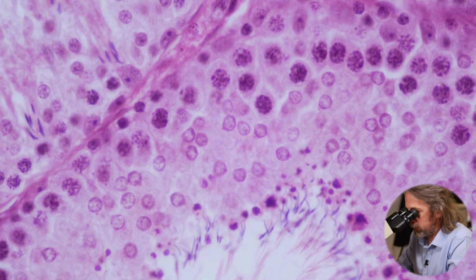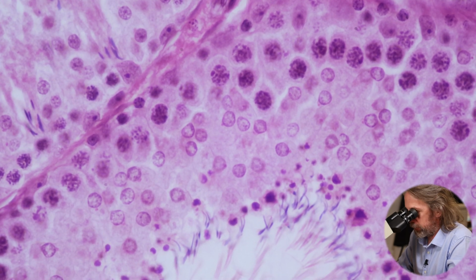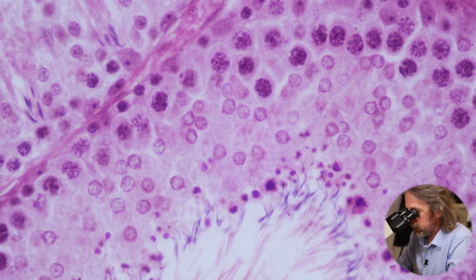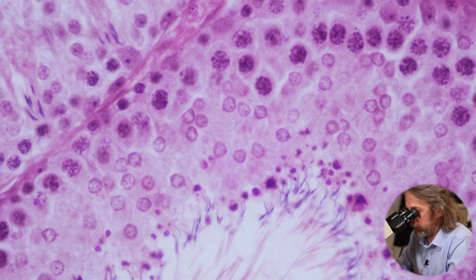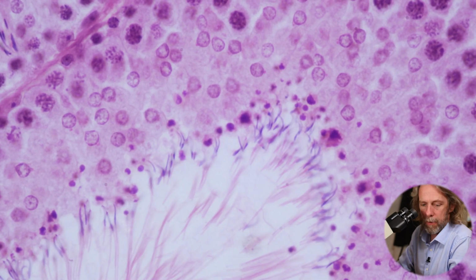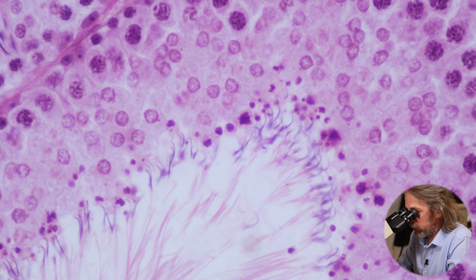Oh, that's quite good too. So there, close to the lumen, we can see what was a much larger cell. It's quite small now. So those little purple dots close to the lumen, those are the cells becoming the spermatids. Now that's really good. They've gone from being big dots to being little dots, much more compacted, right?